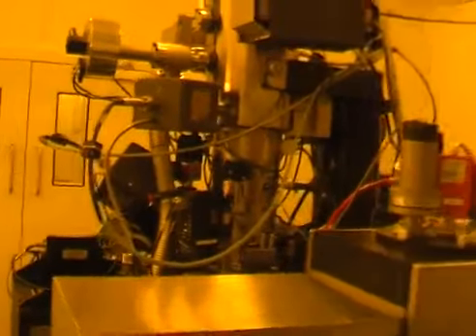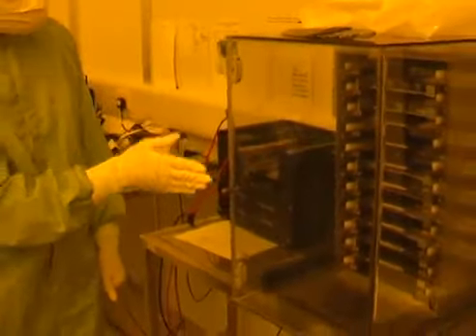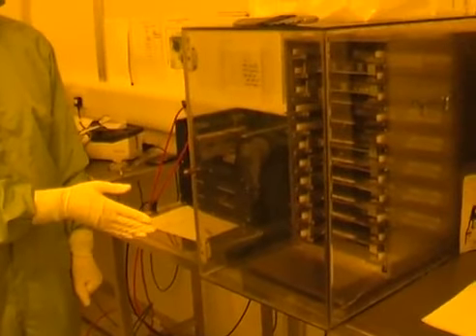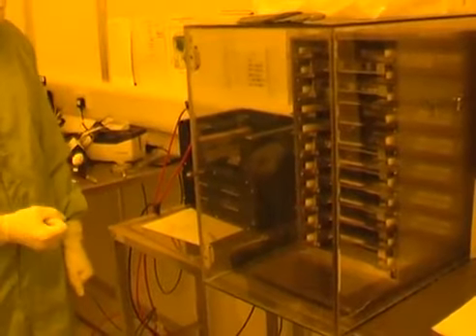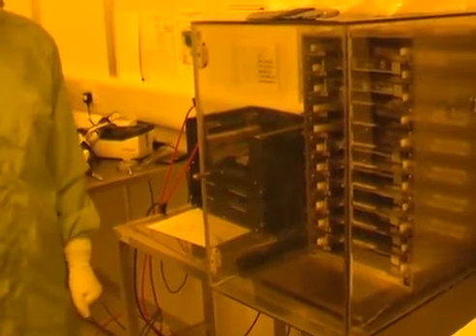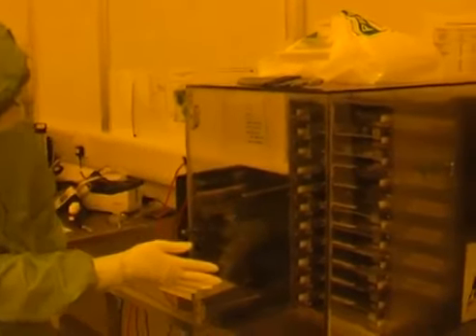What we'll notice is on this rack here we store many of the holders during the day when we're loading and unloading, rather than having to take them out of the cassette on the VB6. And so there are lots of cassettes already available here, so we'll put this sample in one of these cassettes.